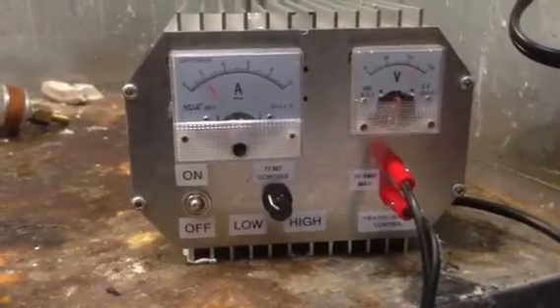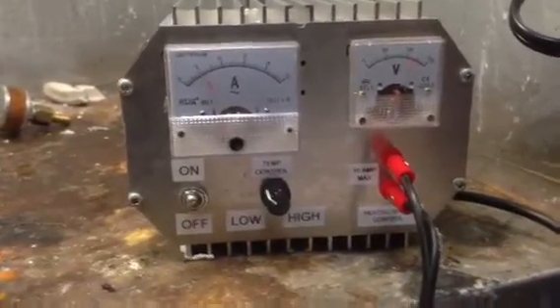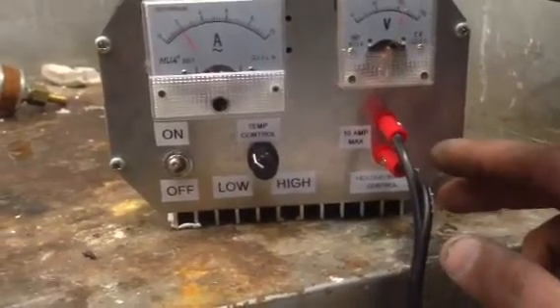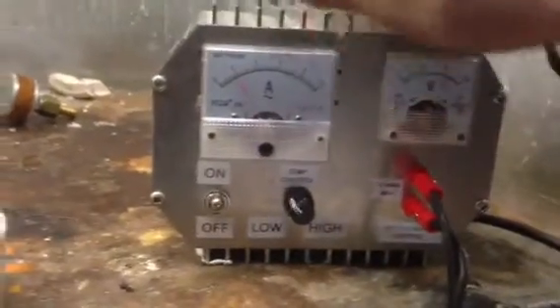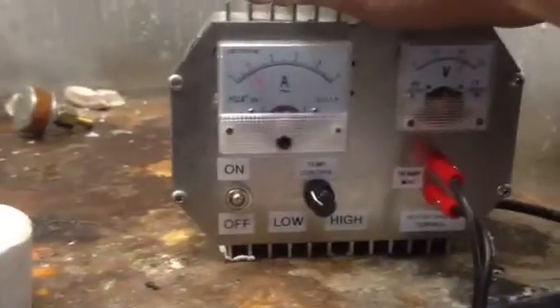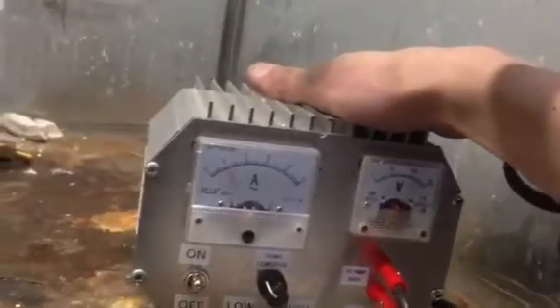It does deal with line voltage though so you have to be careful. These terminals are live with 120 volts right now. You don't want to touch them, you're going to get a shock. The whole thing is grounded though for safety. It's been running about 20 minutes now and it's just getting slightly warm.